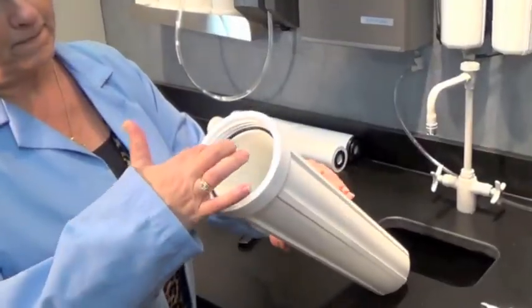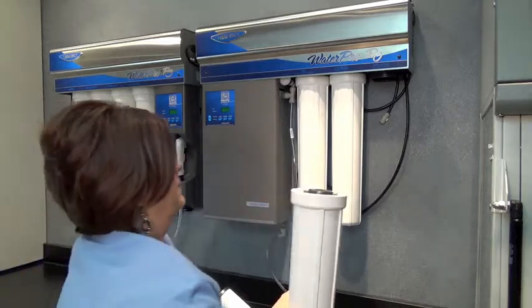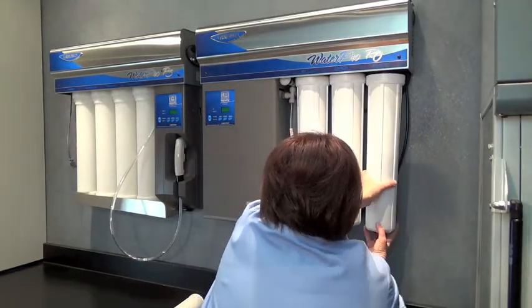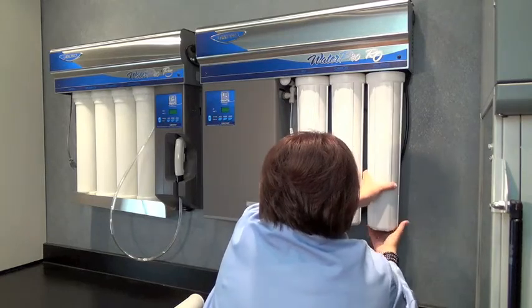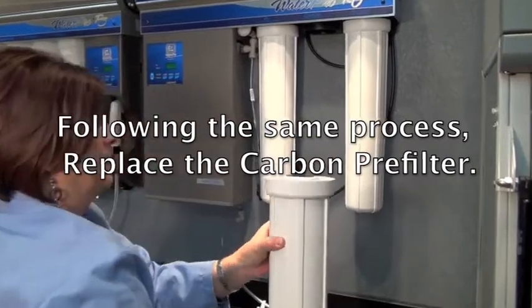Be sure to retain the O-ring. Insert a new filter and replace the bowl onto the unit. Hand tighten the bowls in place. Do not use the wrench to tighten as this may damage the bowls. Remove the middle bowl to replace the carbon pre-filter.